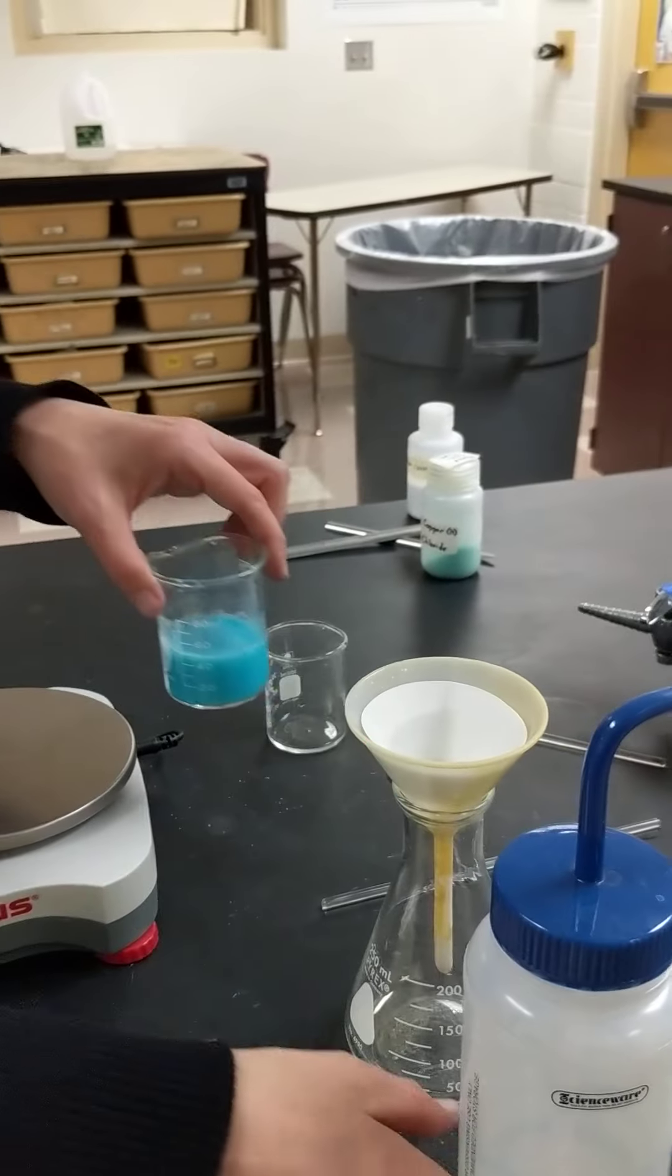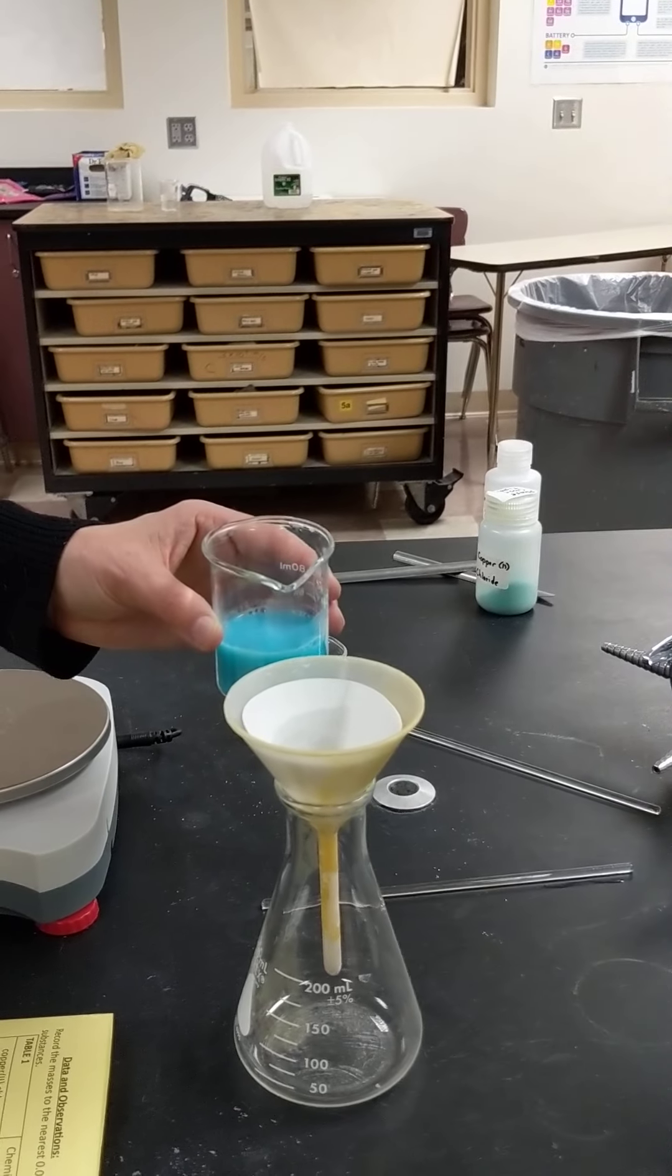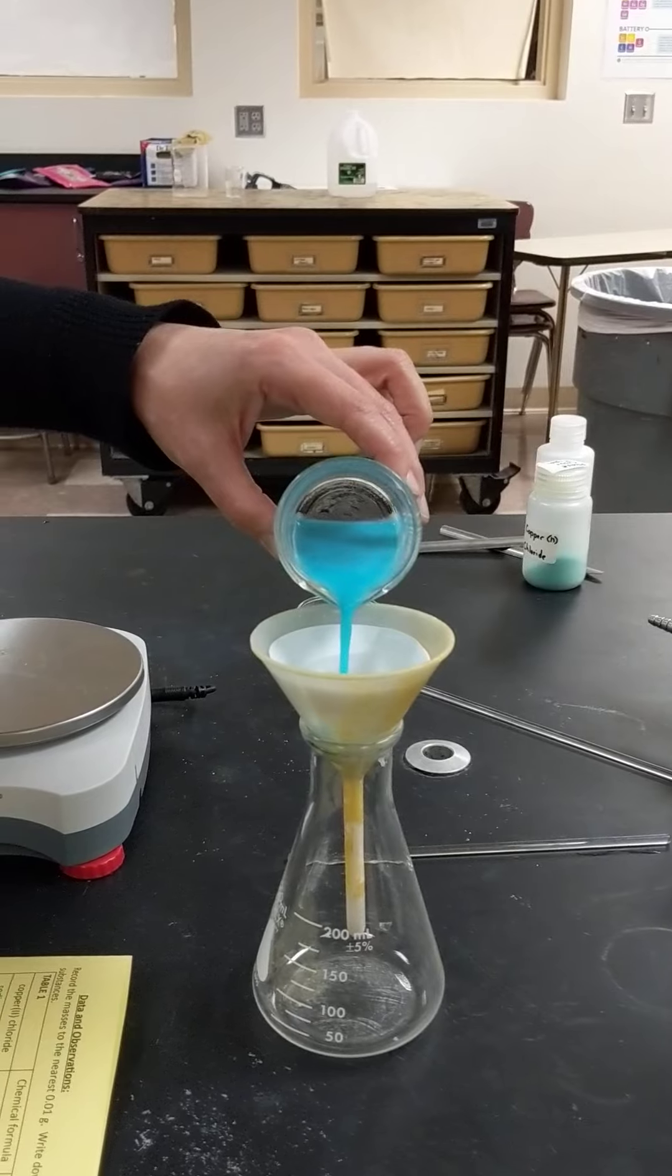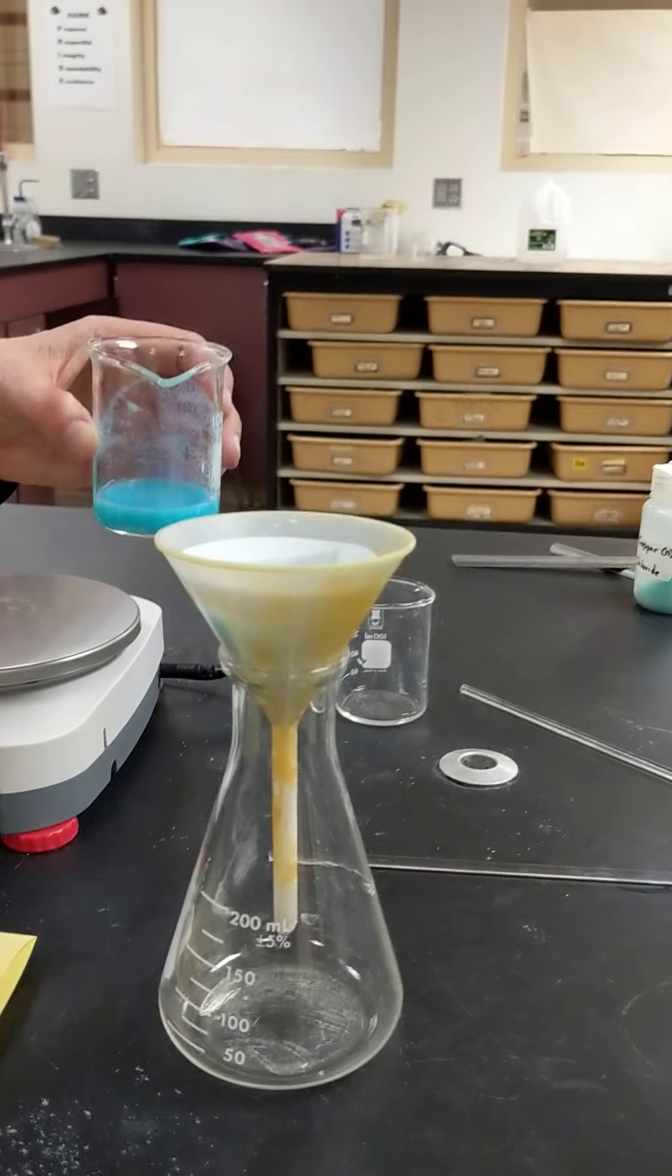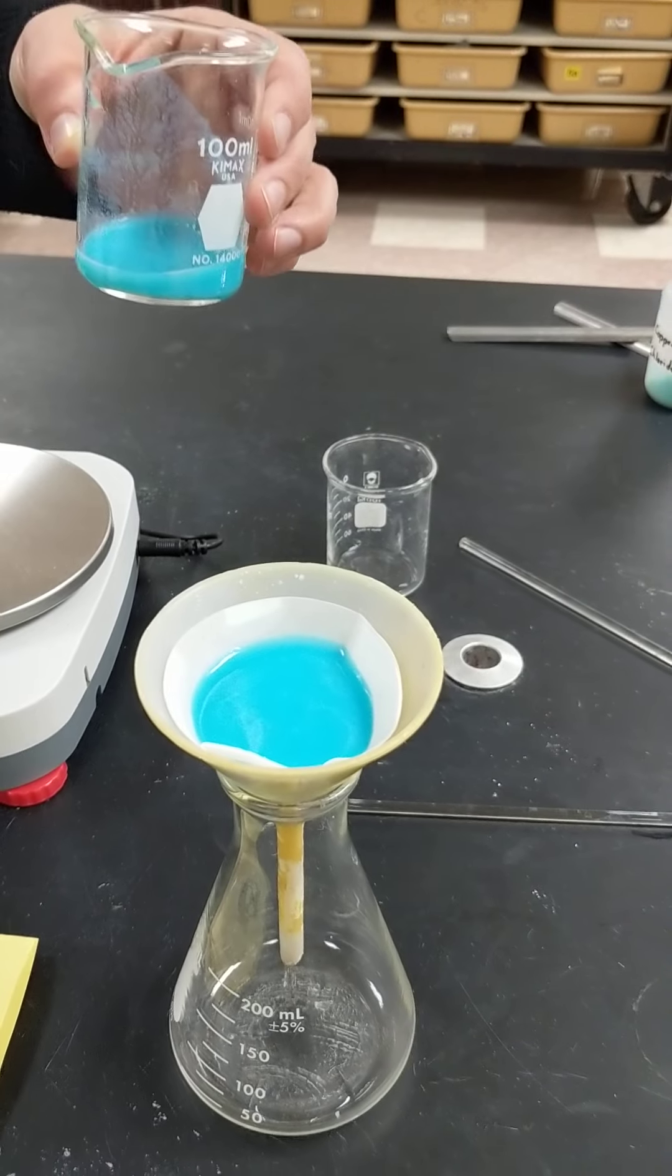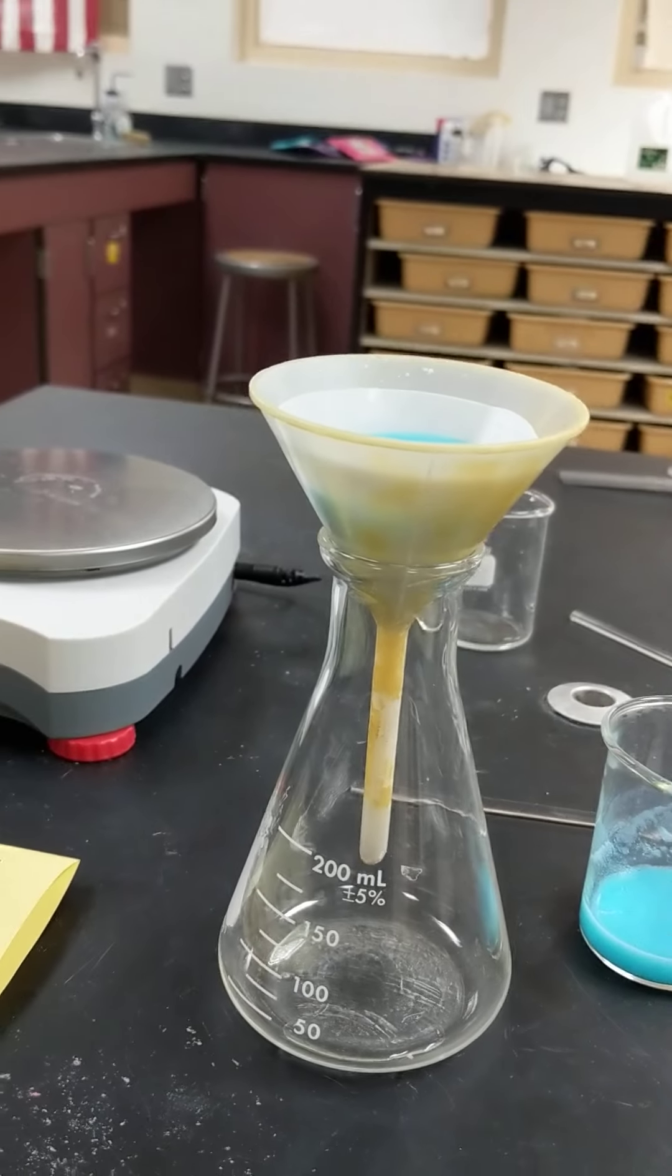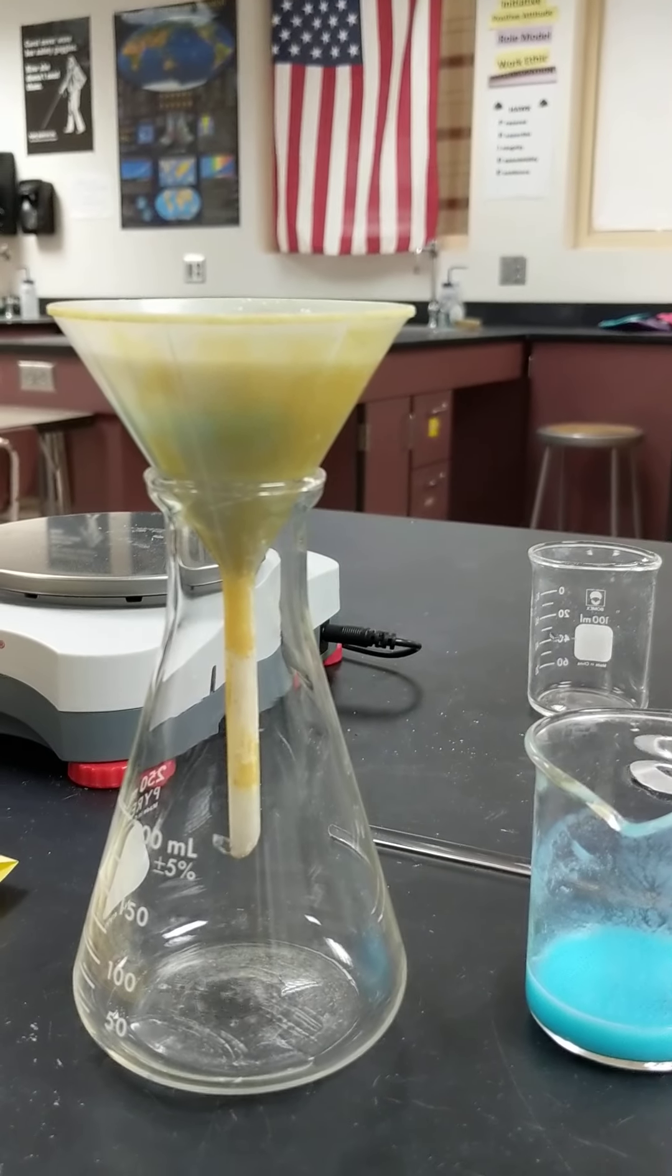And then we're going to pour our mixture in there. And we want to make sure that we don't go... see on the top here we can't go over the edge. So that's probably all I'm going to add for right now. And you'll notice that it's coming out on the bottom.